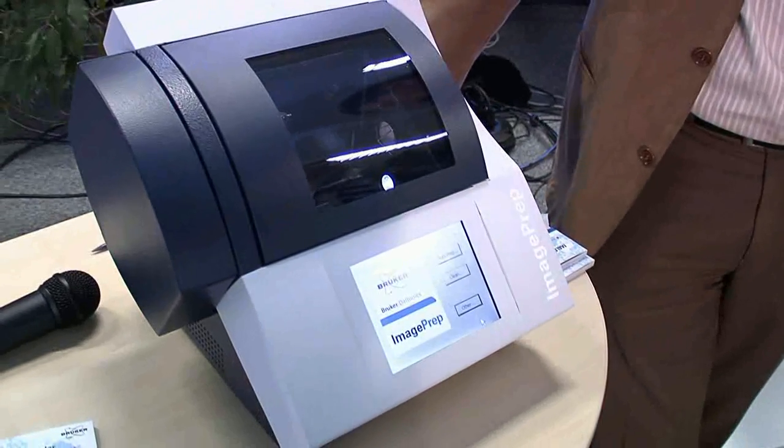You are at the location where things are happening. MALDI imaging as it's developing at the moment is one of the key technologies to look at biomedical molecules and biomolecular distributions on tissue. What is offered now is a generic complete solution to imaging mass spectrometry. The image prep plays a crucial role in that workflow because an imaging mass spectrometer is only as good as the sample preparation is. The main reasons to use the image prep are reproducibility and increased sensitivity at the right spatial resolution. As a researcher, this is a very promising technology — one of the most promising I've seen in recent years, as it allows us a new kind of magnifying lens to look at tissue with alteration due to different physiological or disease stages.